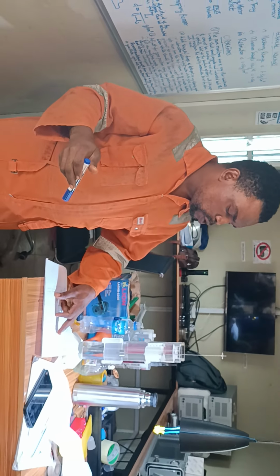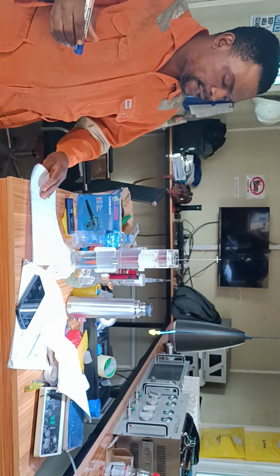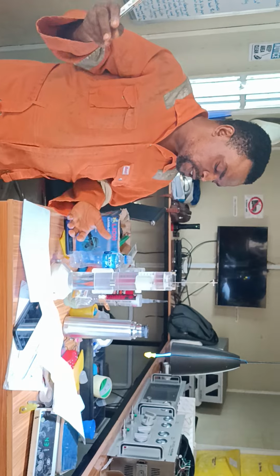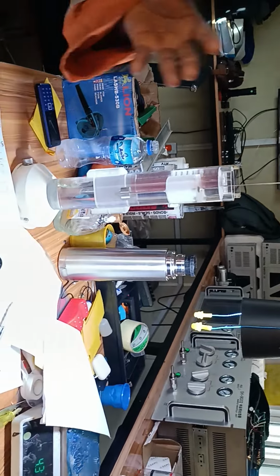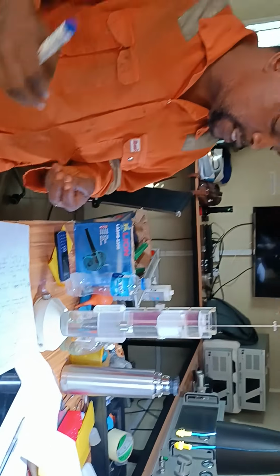Because the shale cutting is small, it can give us a lot of room to play with. Also, because of the small quantity we are using, we can measure densities over a wide range, even on formation not necessarily 100% shale. So even if shale is 40 or 50%, you can do your shale density measurement. Unlike the other one where you wait for 100% shale because you are doing bulk measurement. It is much faster, simpler, and it gives a direct density value.